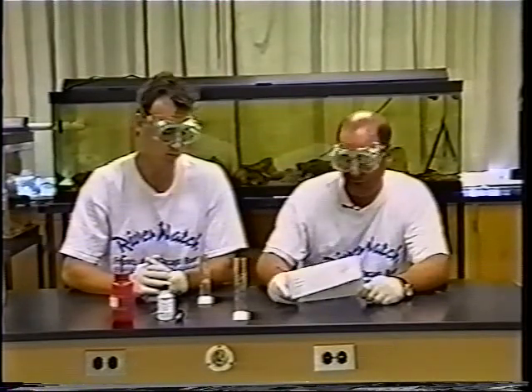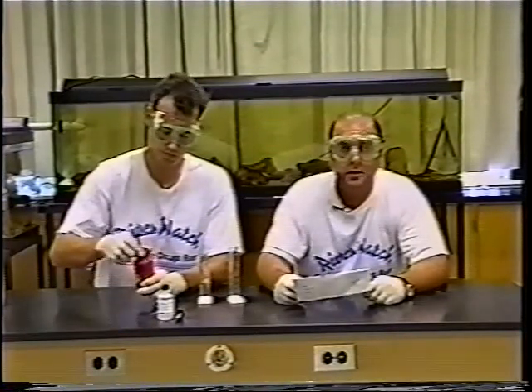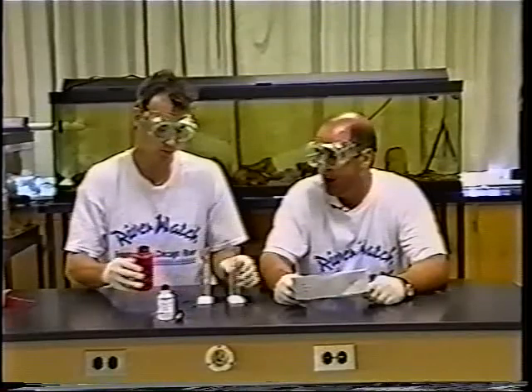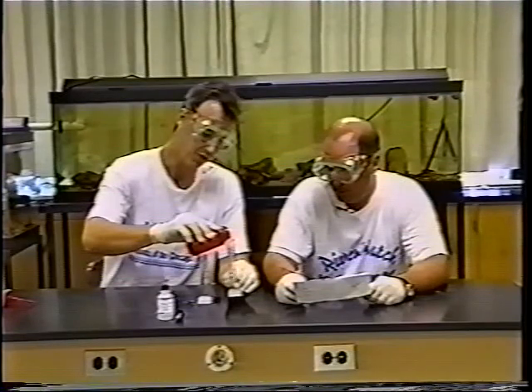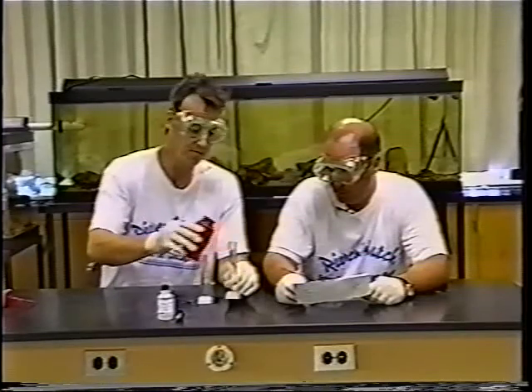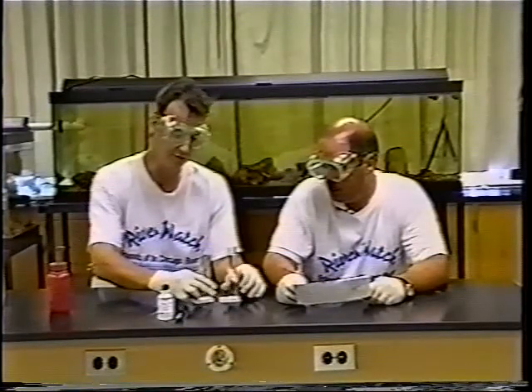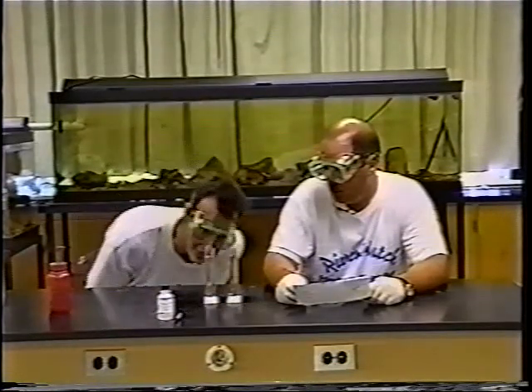Next, fill the comparison tube with the same amount — 50 milliliters — of deionized or distilled water. Since deionized water has had all sediments and particles removed, it's pretty crystal clear. Pour to the same line as the adjacent cylinder. These are mini graduated cylinders, so once you have both samples in, get down at eye level and make sure the bottom of your meniscus is lined up to the line in the graduates.